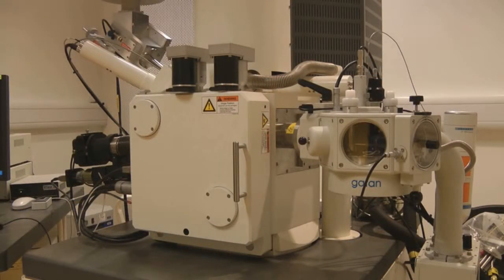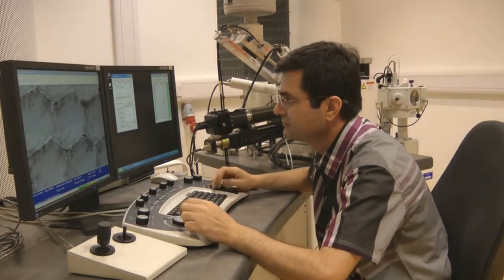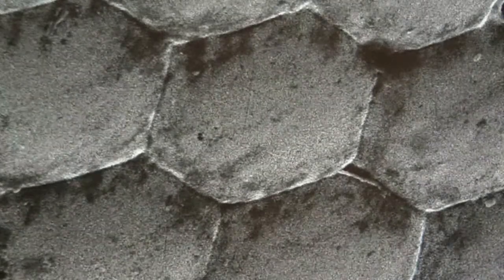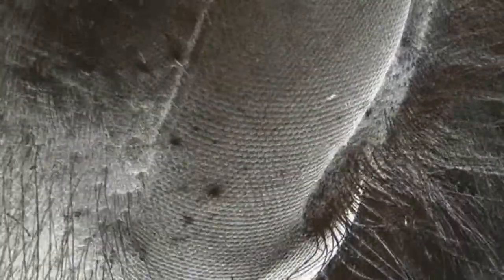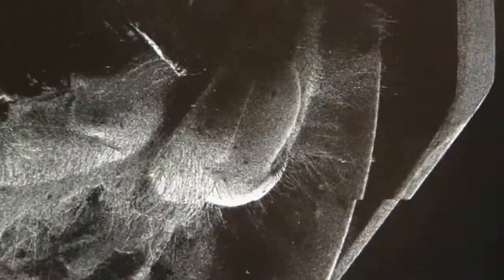In SEM, magnifications of several thousand times are possible, and this technique is used to look at the surface of the samples. What you can see on the screen is not a piece of football. You can't put a football in an SEM electron microscope. This is a close-up view of something very different. Moving out of magnification and going to a smaller magnification, you can actually see what the sample inside the microscope was. This is an eye of an insect.